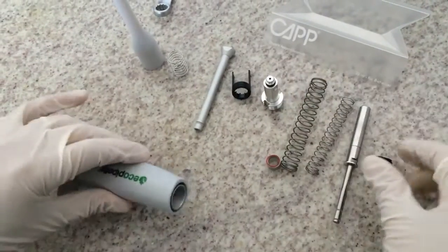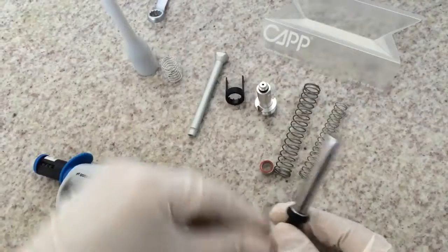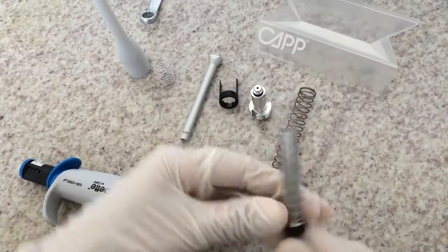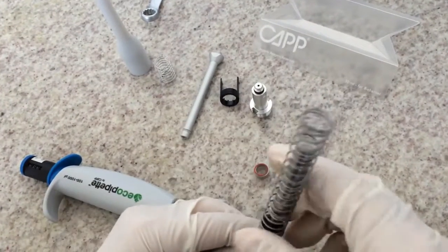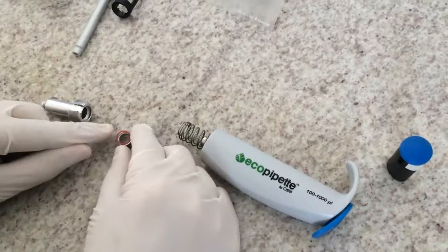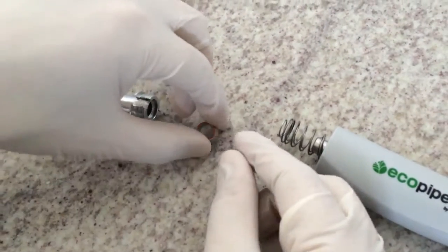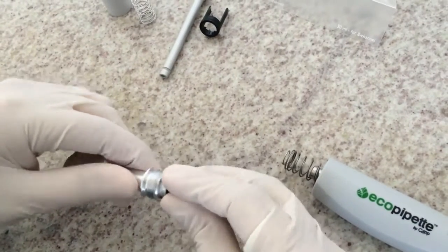Place the isolation insert. Mount the pipetting and blowout spring on the piston. And put it back on the pipette. Make sure that the O-ring is properly fit into the seal. Connect it to the bottom part.